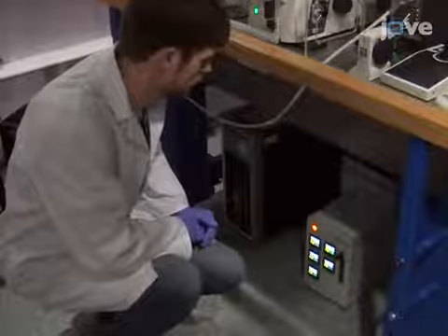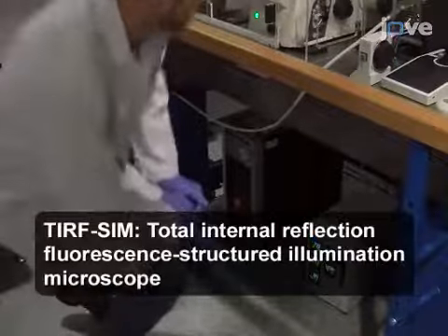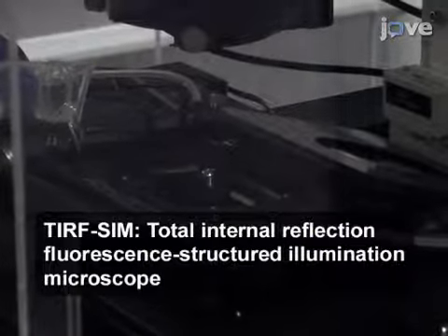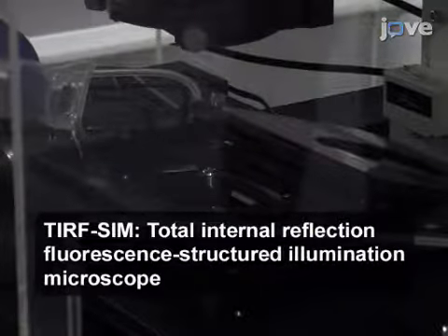To begin, turn on the incubator for the stage heater of the TIRF-SIM system and fill the reservoir with distilled water to fully cover the base of the heating element. Let the water equilibrate to 37 degrees Celsius.